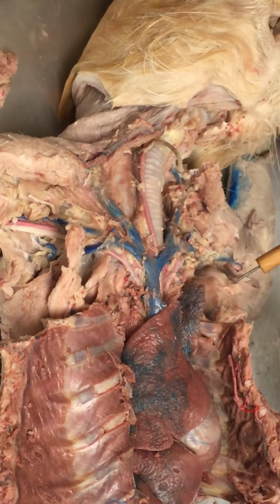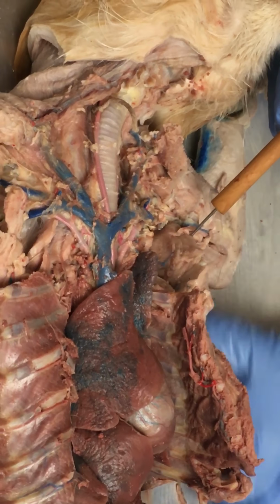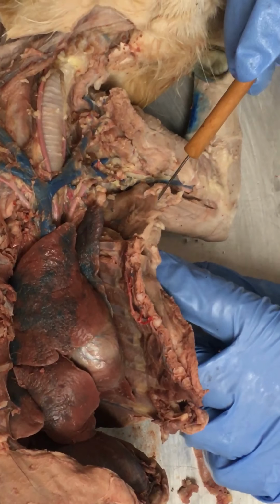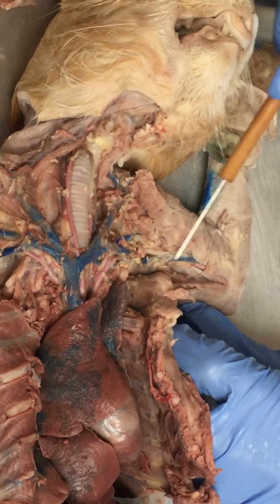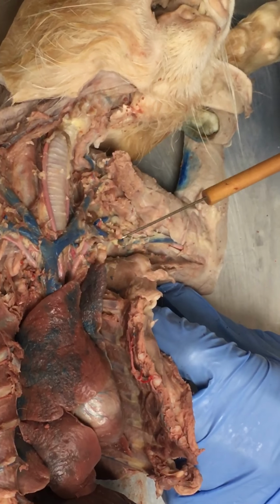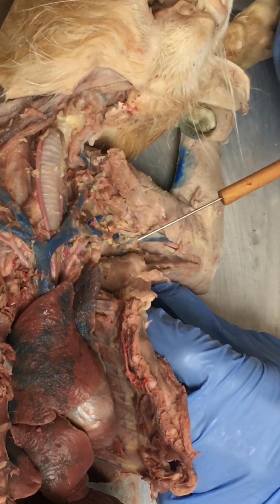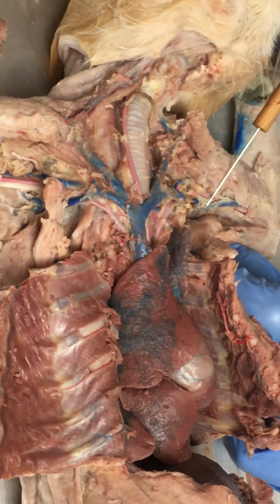So right here, we've tried to put everything back in its anatomical position. This would be the axillary region, armpit, right? So if we take that line and extend it up here, then where that blood vessel crosses our axillary region, now we're just going to call it the axillary vein. It's the same blood vessel. I've snipped it here, you can see, but Kelly snipped it. No, it was me. So we call that the axillary vein.